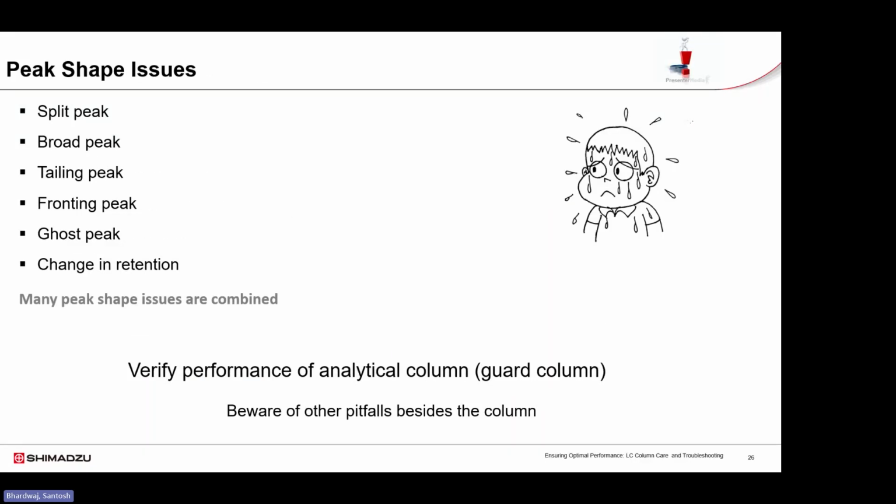Peak shape is an important indicator of the health of your column and overall LC system. Common peak shape problems include splitting, tailing, fronting, broadening, ghost peaks, and changes in the retention time as well. These issues often have multiple possible causes, such as column contamination, problems with the guard column, overloading the column, and extra column dead volume. By carefully observing and understanding peak shapes, you can quickly identify underlying problems and take the appropriate corrective action before they affect data quality.